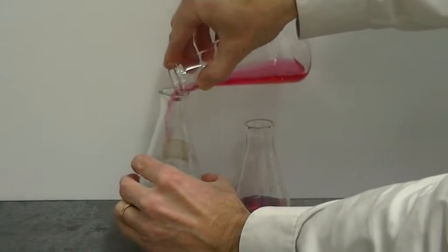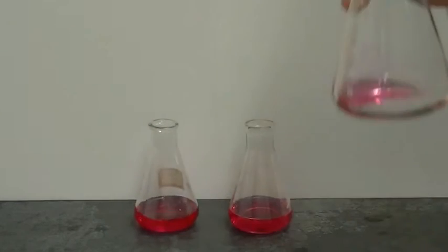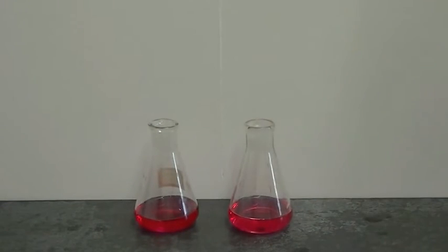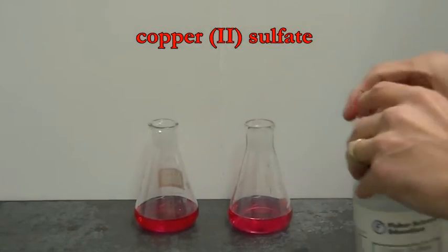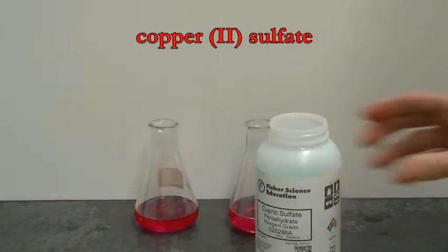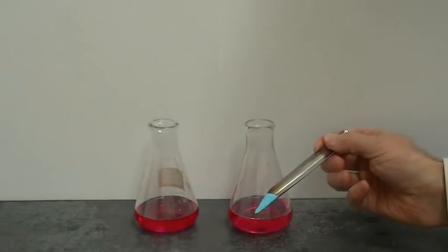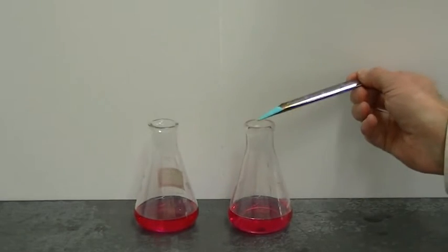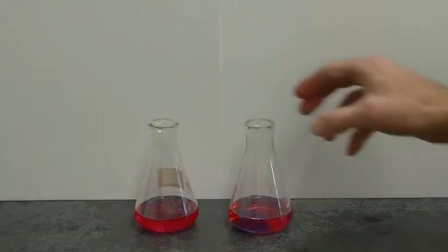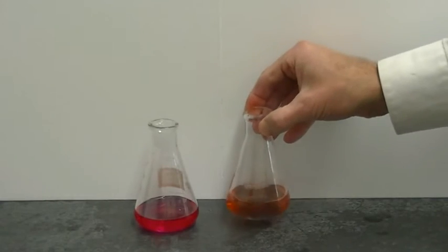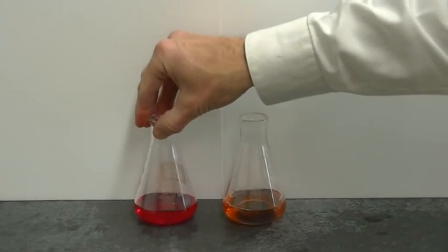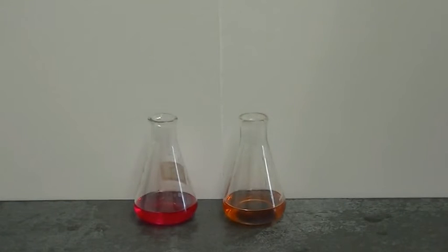I'm going to add a little bit of our dye to each of these two flasks. And then to this flask over here I'm going to add some copper sulfate as a source of metal ions. Note that the copper sulfate is blue in color. We'll add it to this flask, give this flask a quick swirl, and we immediately notice a color change. And that color change is indicative of betanin being oxidized. And once again that's indicative of the berry dye containing betanin.